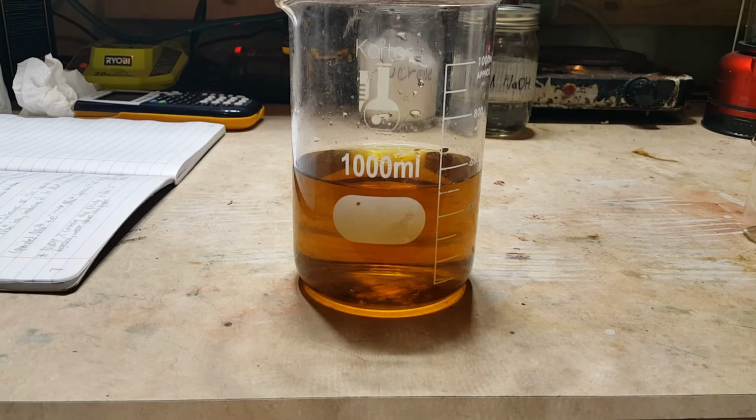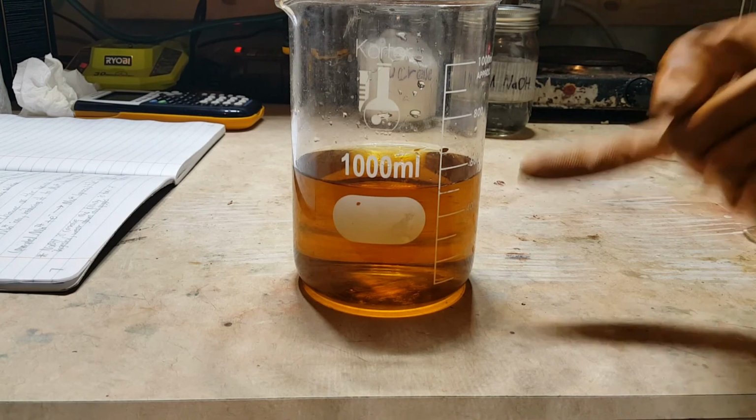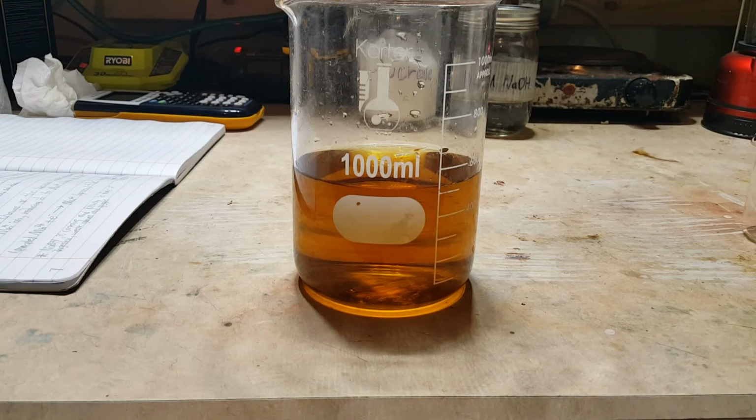Now, it stops at the Mn+4 ion because this reaction produces manganese dioxide, and MnO2 is not soluble in water, so it will join back together and stop transferring electrons. And it creates the suspension of tiny particles of manganese dioxide, giving the solution an orange appearance. Now, if you let the solution sit for a day or two, then you'll see the manganese dioxide fall back down to the bottom and the solution clear up.